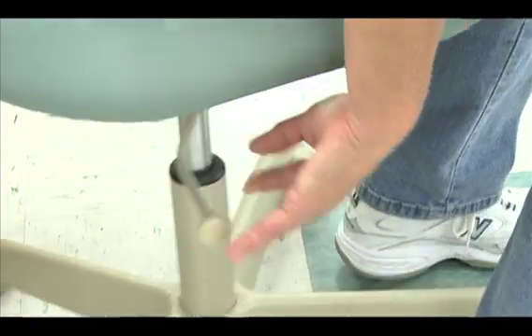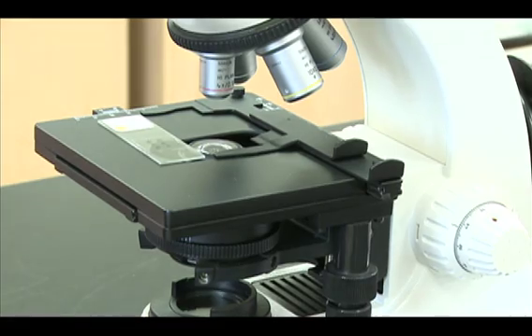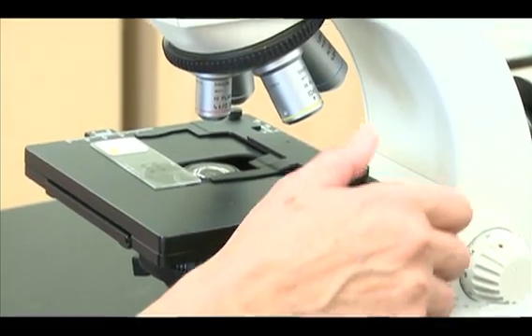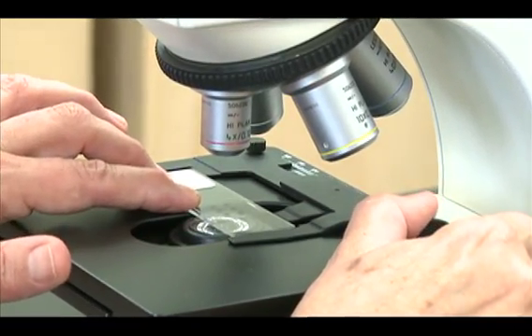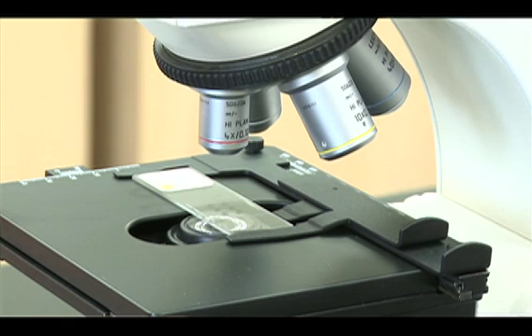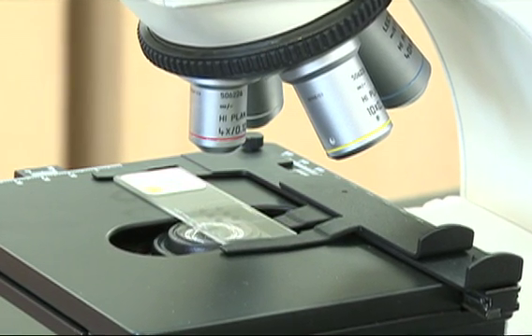Adjust your chair for comfortable viewing. Open the clips on the stage and gently advance the slide between the clips and align it with the back of the holder. Gently release the thumb control to hold the slide in position.